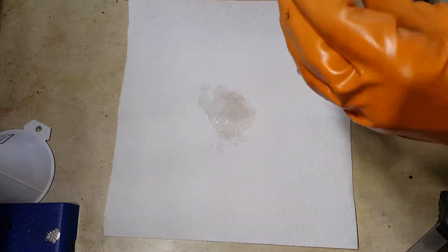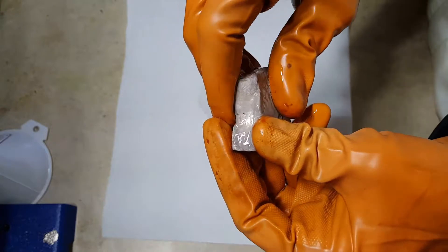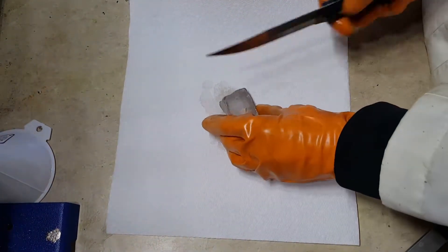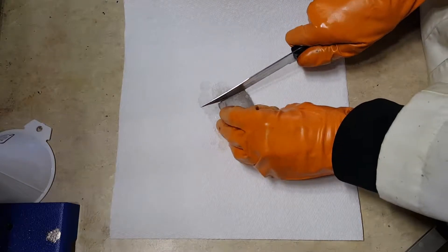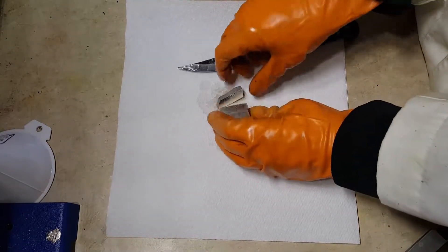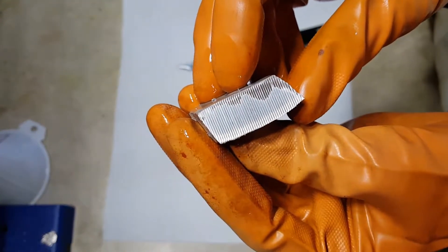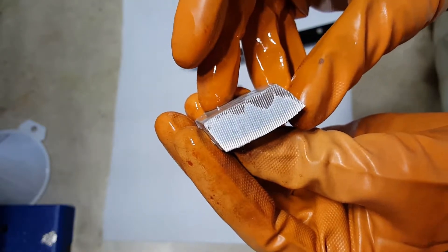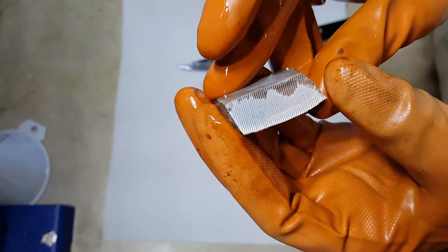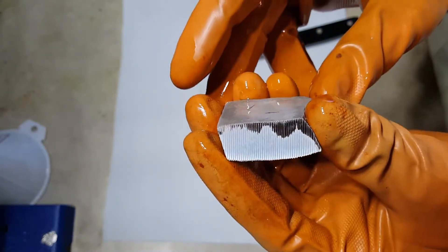Now this is actually a very, very soft metal. You can easily bend it and cut it with a knife. So let me cut it. Now if you cut it, it reveals the surface of pure unoxidized sodium — it's a remarkably shiny metal. Within a few seconds, it will again coat itself in white sodium hydroxide, oxide, and carbonate.